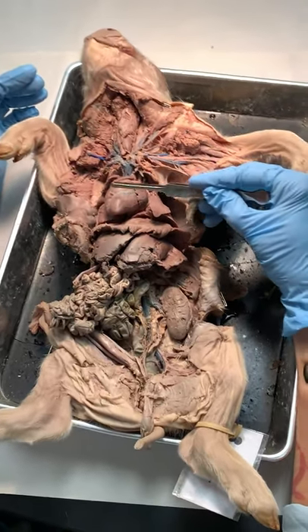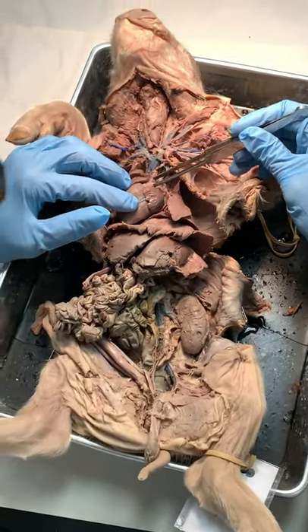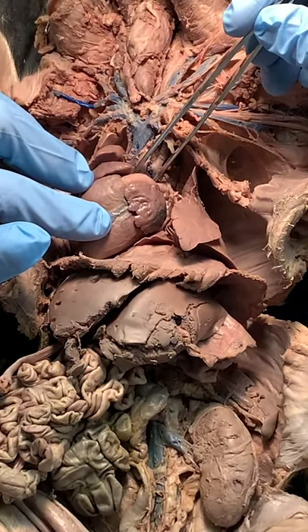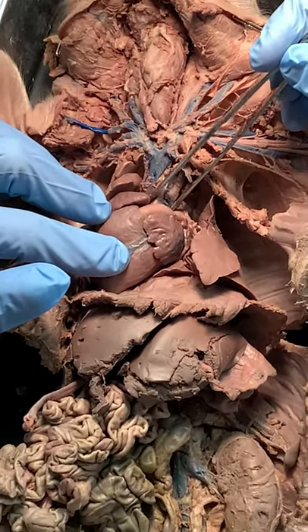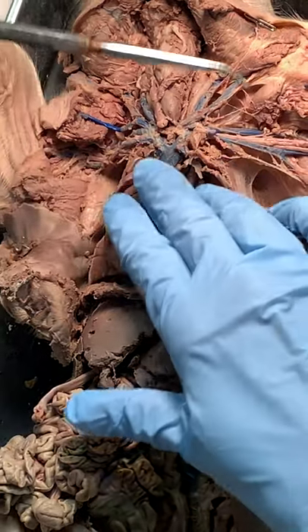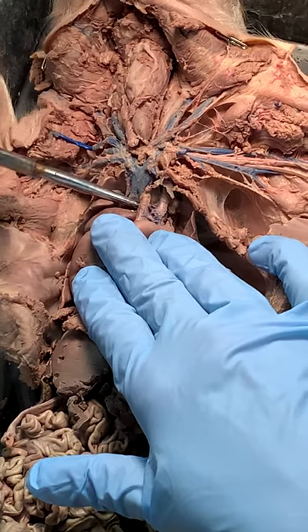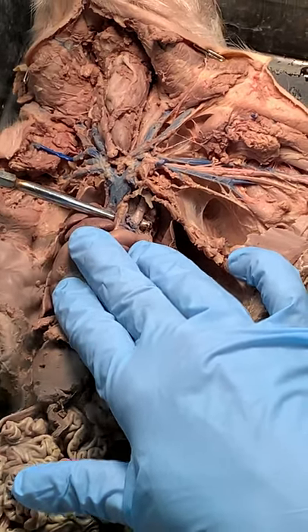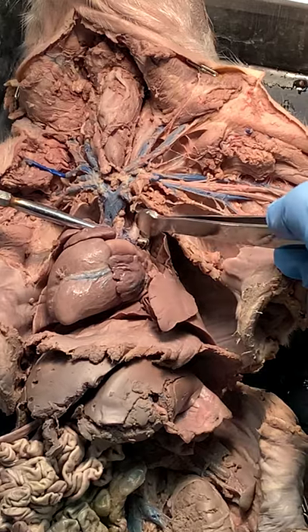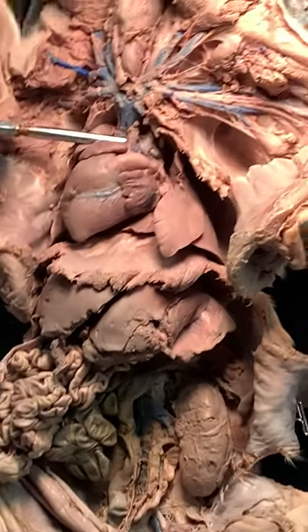Okay, so heart location — just to reorient: pulmonary trunk, aorta, and this is the aortic arch behind it. What's off of the aorta? I have a brachiocephalic trunk and a left subclavian. That's how I know that's the aorta, because I can see those two things coming off of it.